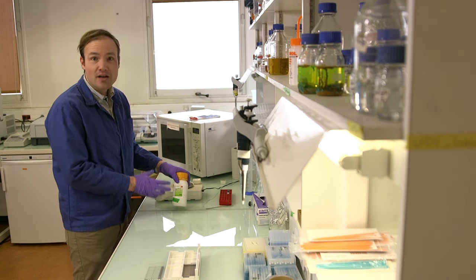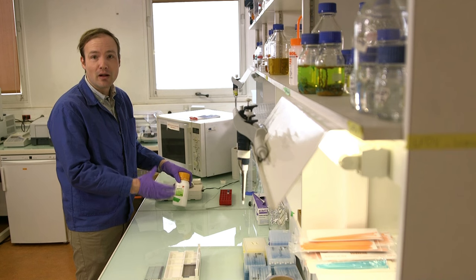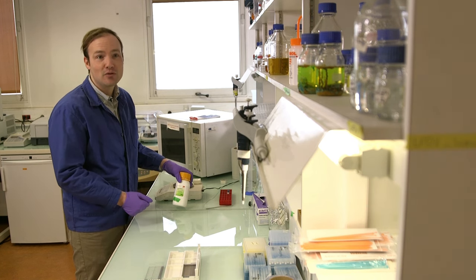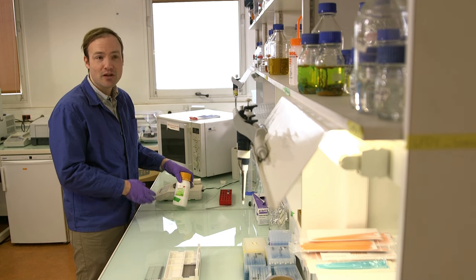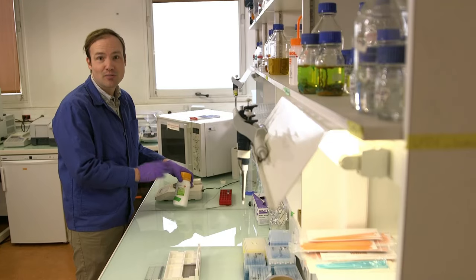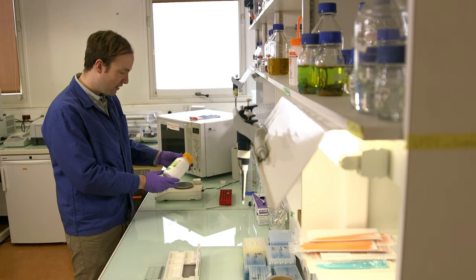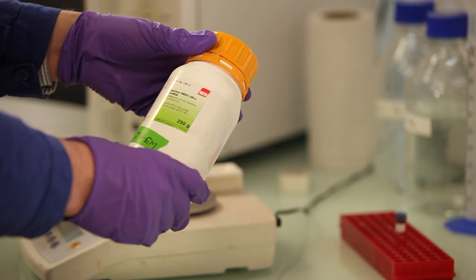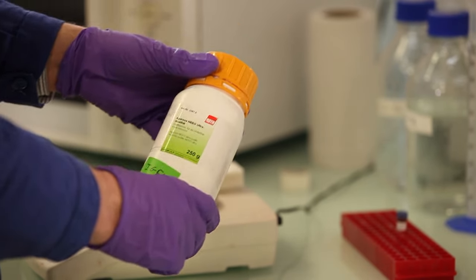We're also not looking for low melting point agarose. Depending on the lab where you're working, people may be using low melting point agarose, that's for other applications. That won't work for these gels either. So we only want exactly agarose, accept no substitutes. Now, this bottle is labeled in German, which I do not read, but I'm pretty sure it's the right stuff.